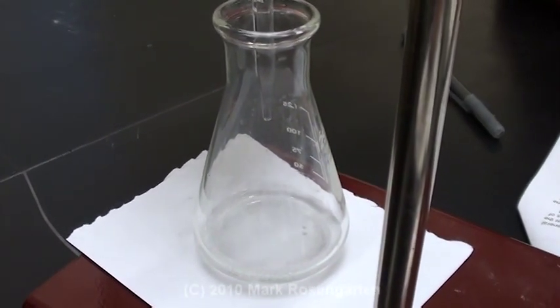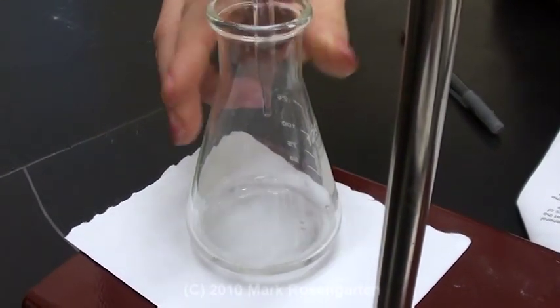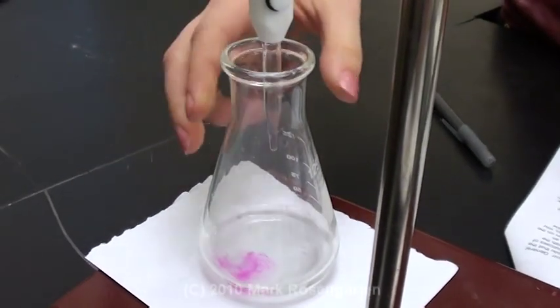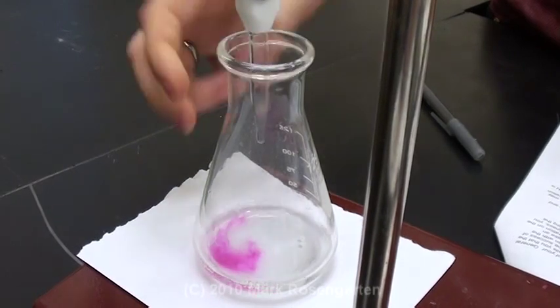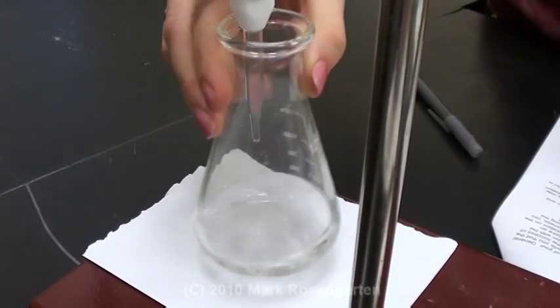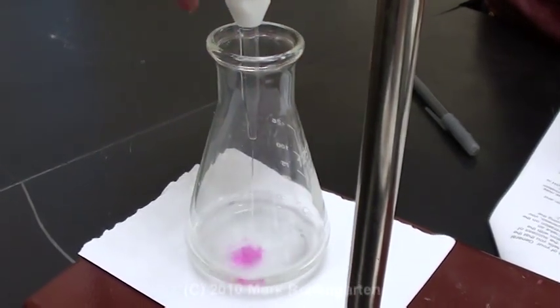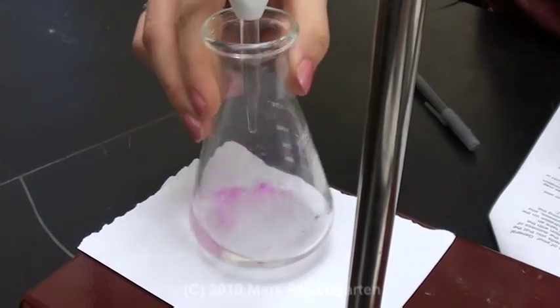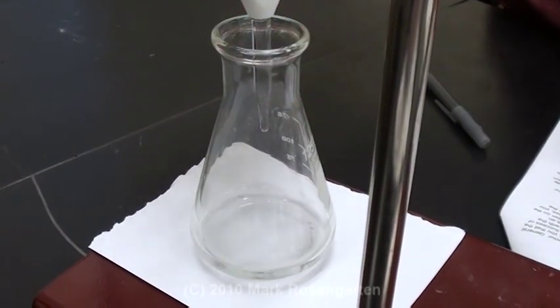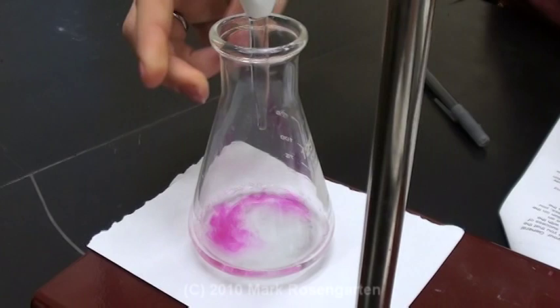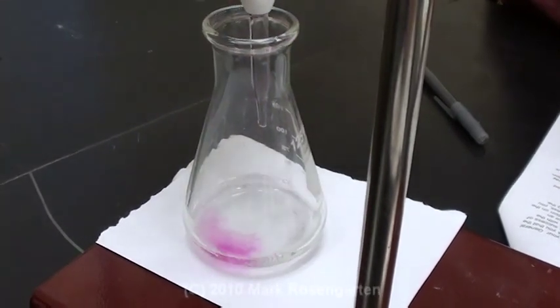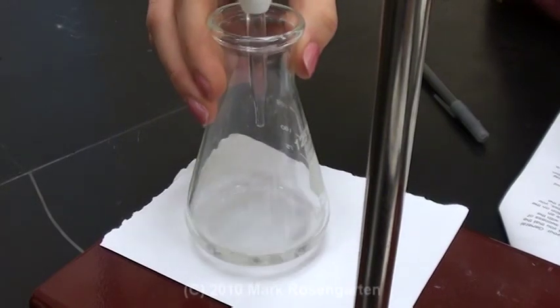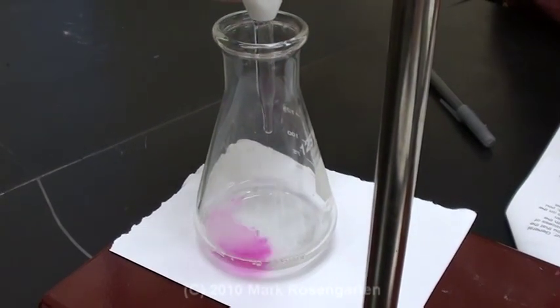And then we have to mix it, right? And we're waiting for it to be there for 10 seconds? Now there's still a higher concentration of acid than base, which is why the pink color disappears. But as you add more base and the pH rises closer to neutral, the pink color hangs out a little longer. So you add a little less each time.